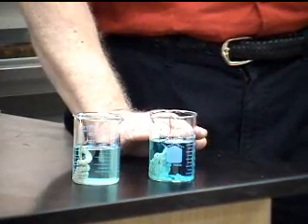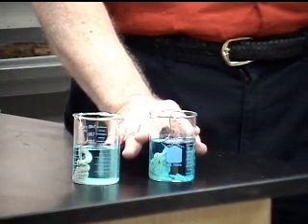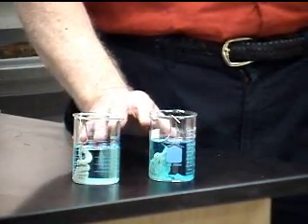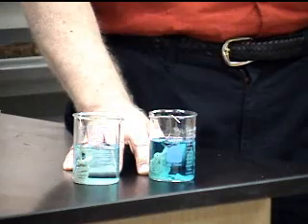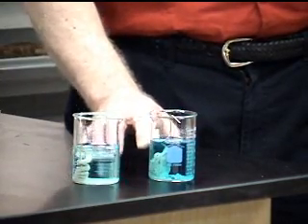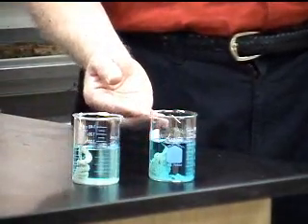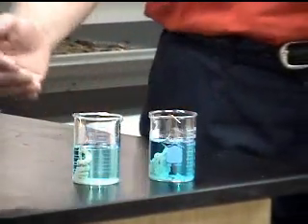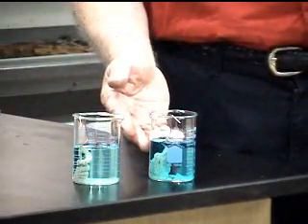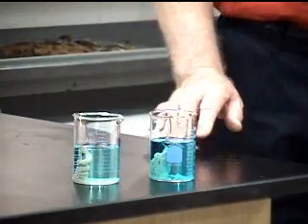And this has to be known because if you understand that concept, if you think of dumping different materials into the environment, if a certain amount of the material is removed through some process, then more of it is just going to enter that environment. As we see here, the silver has gone out.